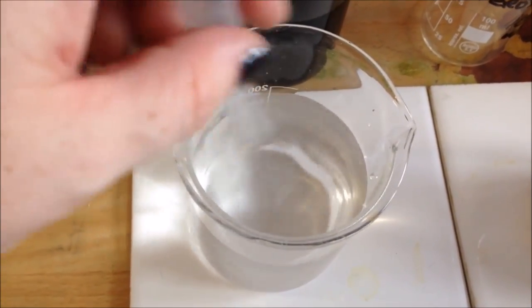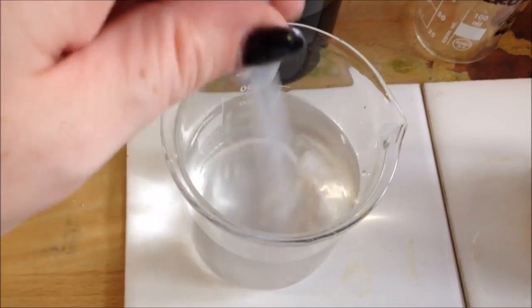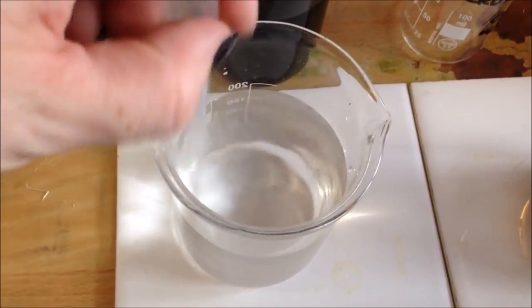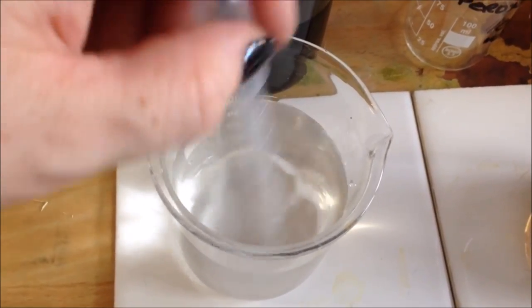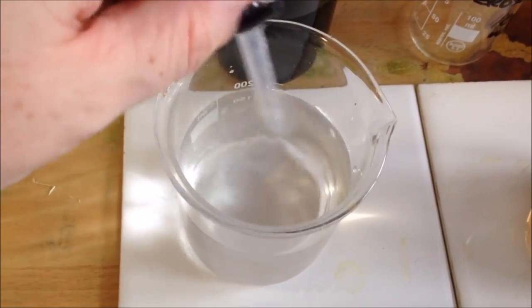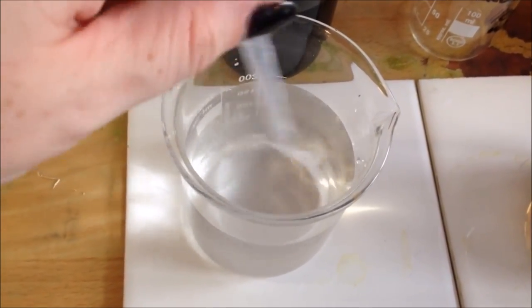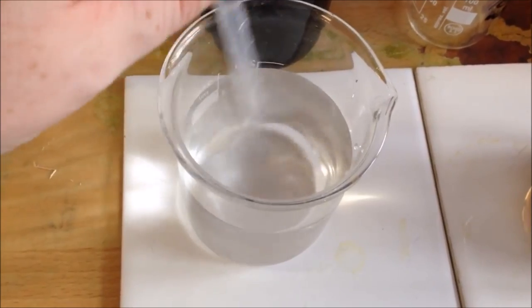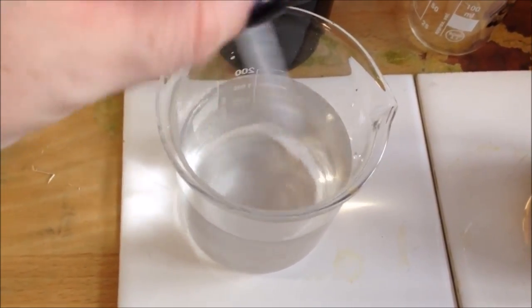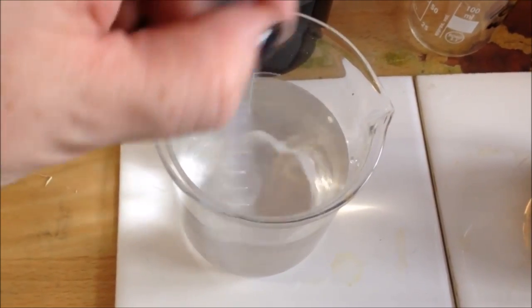Okay, so I've eventually got this to work, and when it goes, it goes very, very quickly. It's good if you maybe do this in pairs—one person doing the solution, one person doing the timing—just because you can't move your hands quickly enough to get an accurate result. You can take it in turns for each different concentration. When this goes, it goes incredibly quickly. It's a split second change.